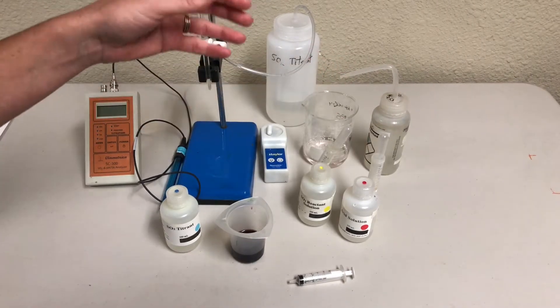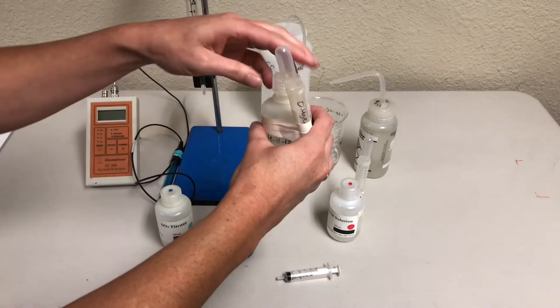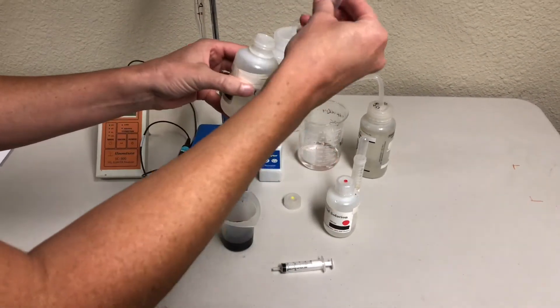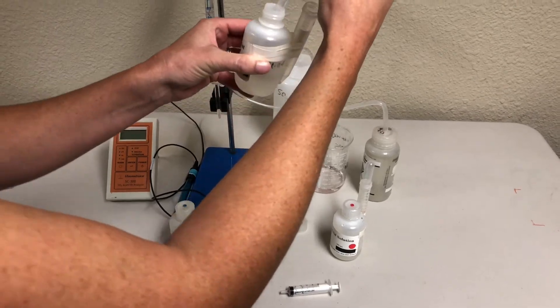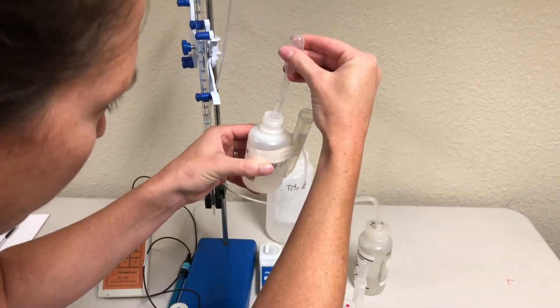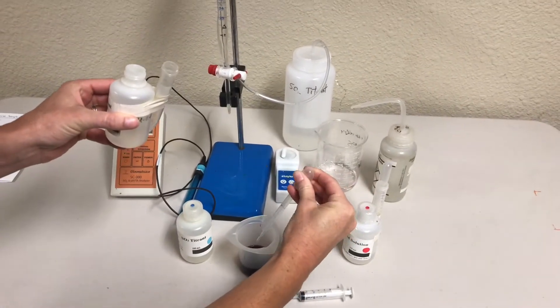This is the equivalent of about a thorough bulb squeeze of these pipettes. Or you can use the lines on the transfer pipettes themselves. Squirt 2 mils into there.